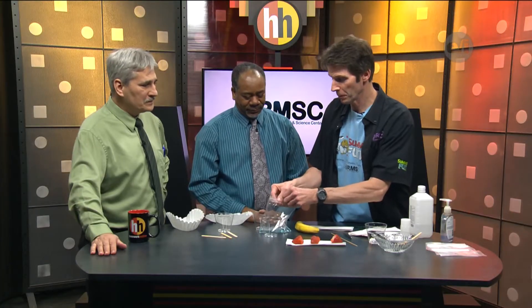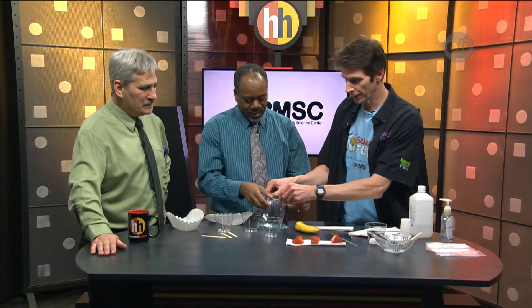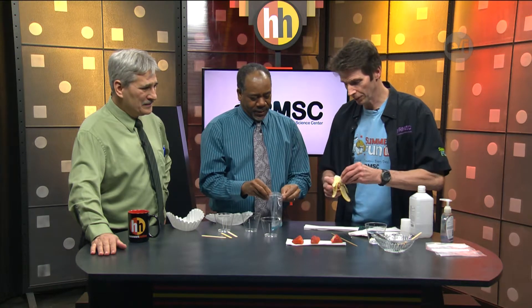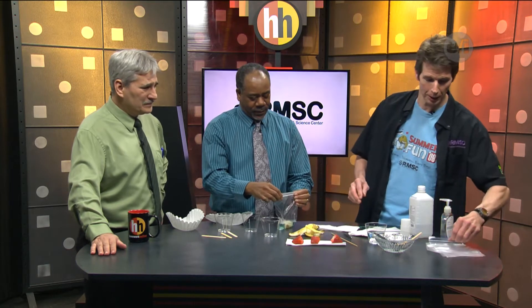What we're going to do is first start by breaking down — if we can open up this bag. We'll give you your banana part. Now we'll break it up. And I'm going to get some strawberries.